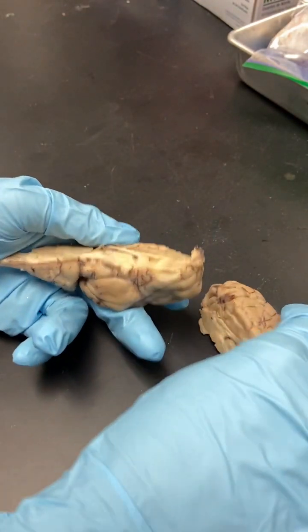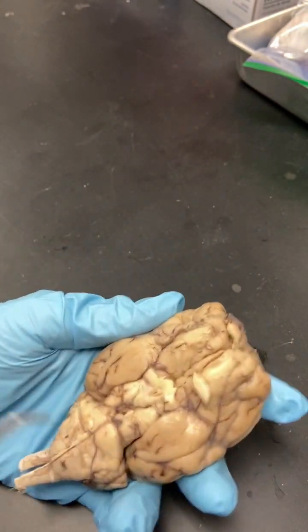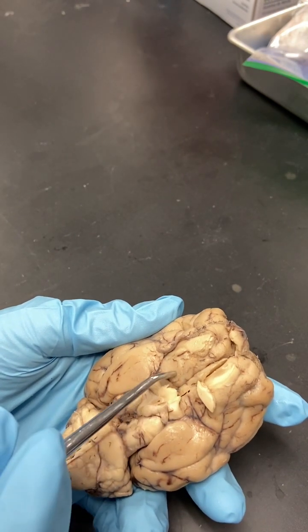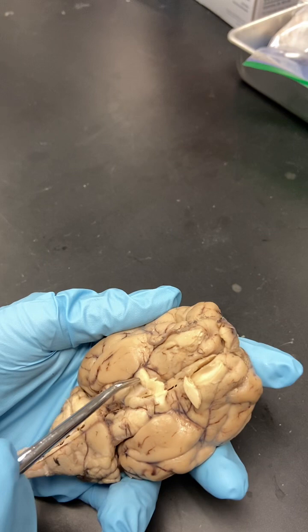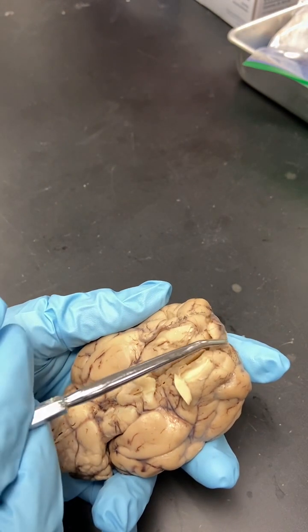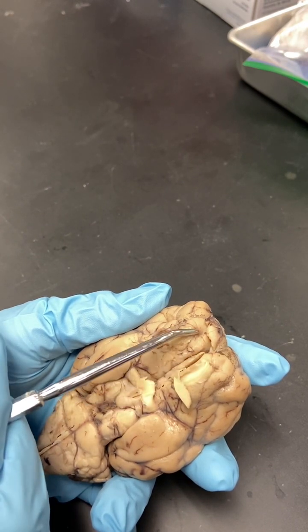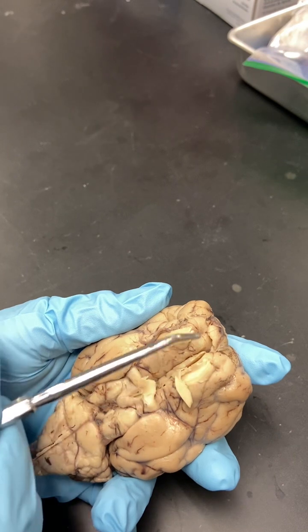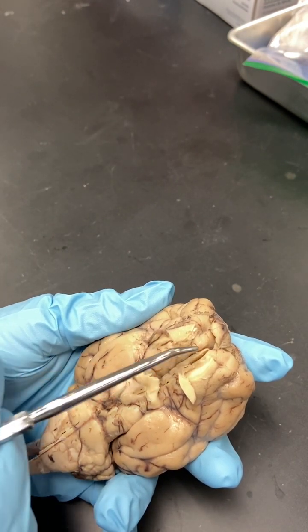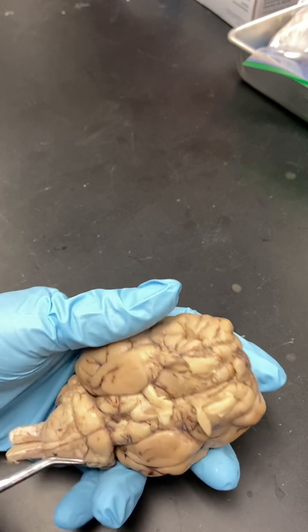On the underside, some of the structures on the underside, that's what we have here. So this would be the optic chiasm. It was an X, but these two parts fell off, so now it's just a V, and that plays a role in vision. Up here would be the olfactory bulbs, which went down the nostril. That would be the right nostril, left nostril. The olfactory bulbs are connected to olfactory tracts, which come down and connect to the hippocampus. The hippocampus is long-term memory.